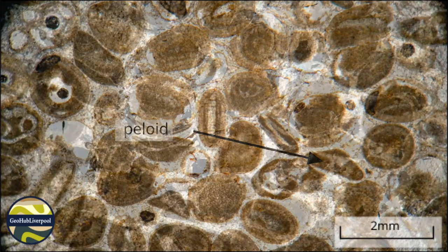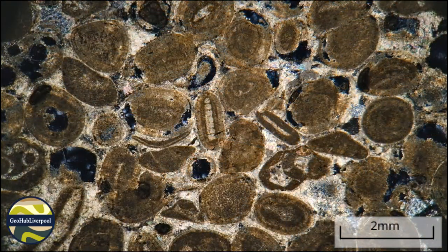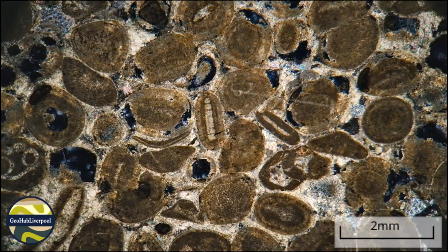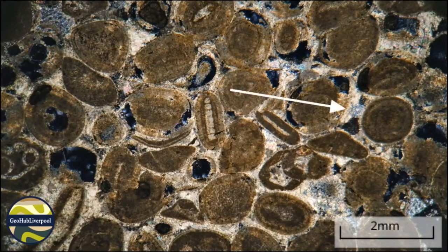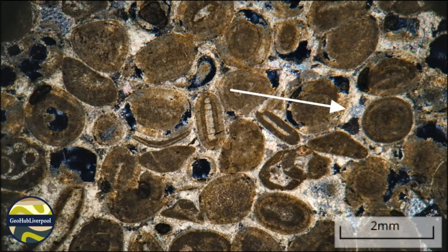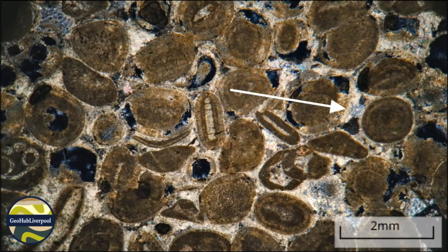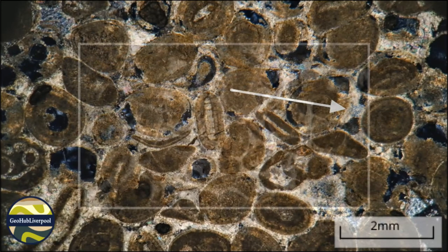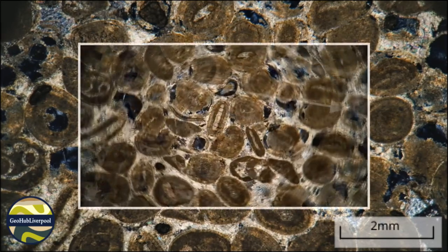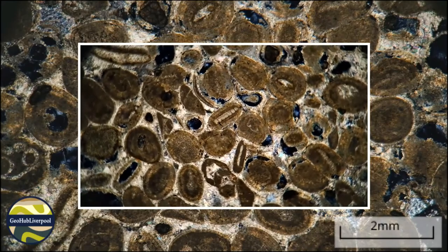Under cross polars, the calcite is identified by its very high — up to 7th order — interference colours. These are delicate pastel shades of pink and brown. When in extinction, the calcite doesn't go completely black but shows a fine speckling.